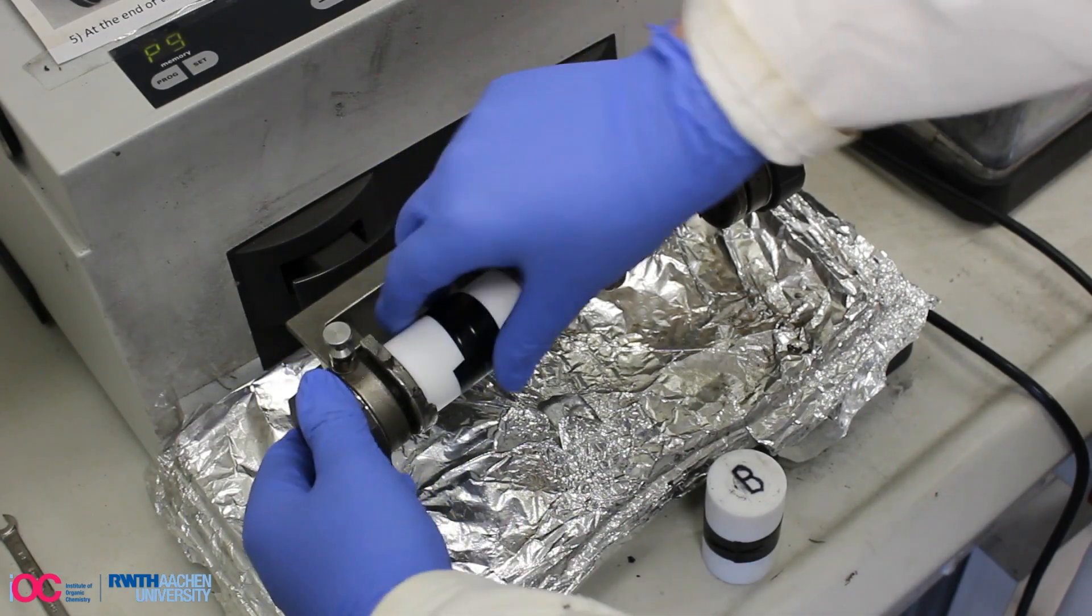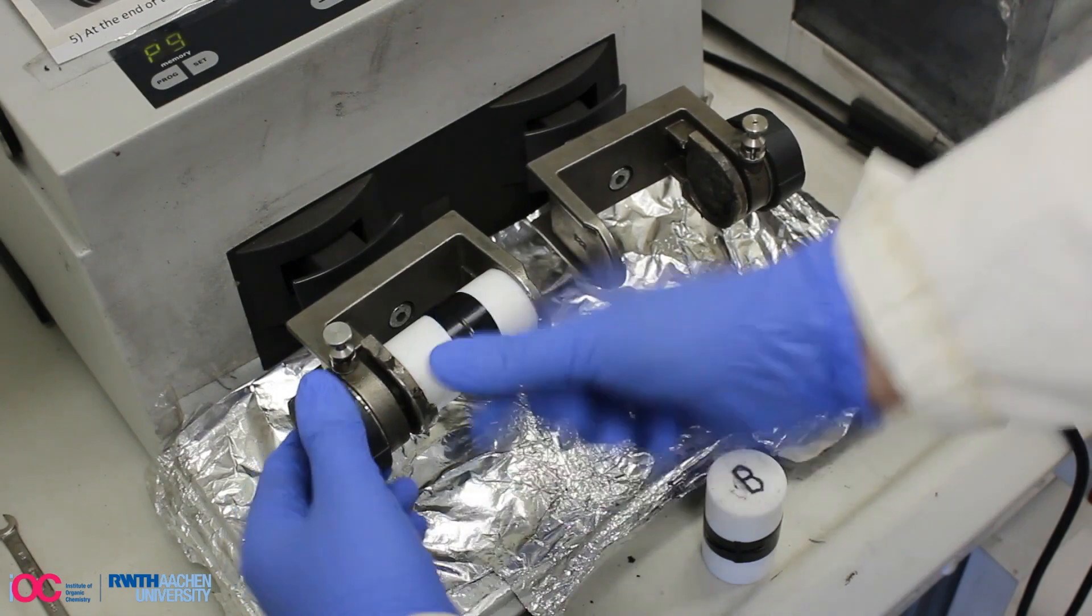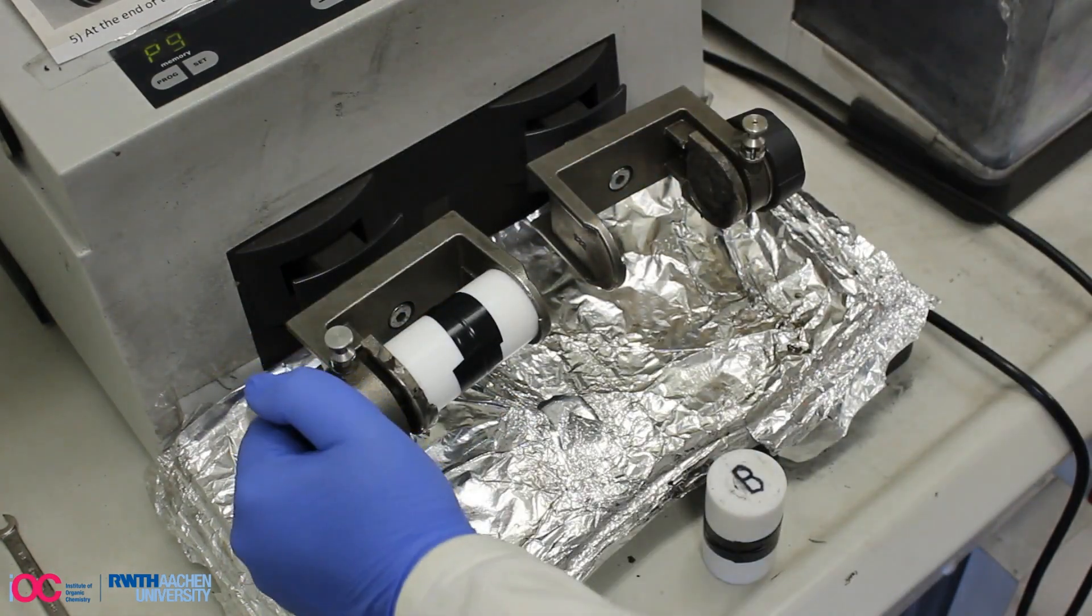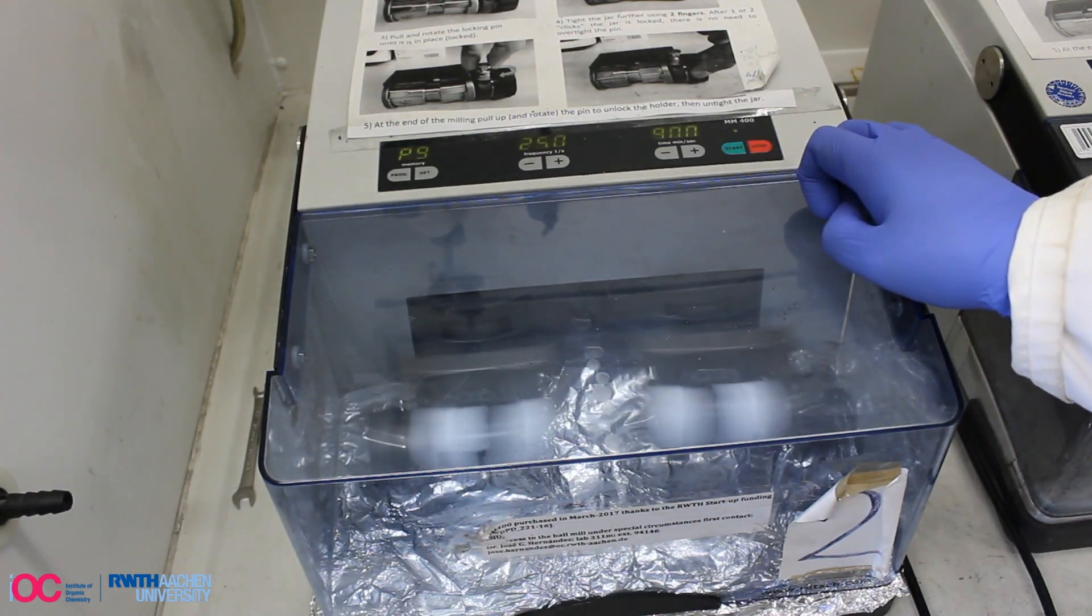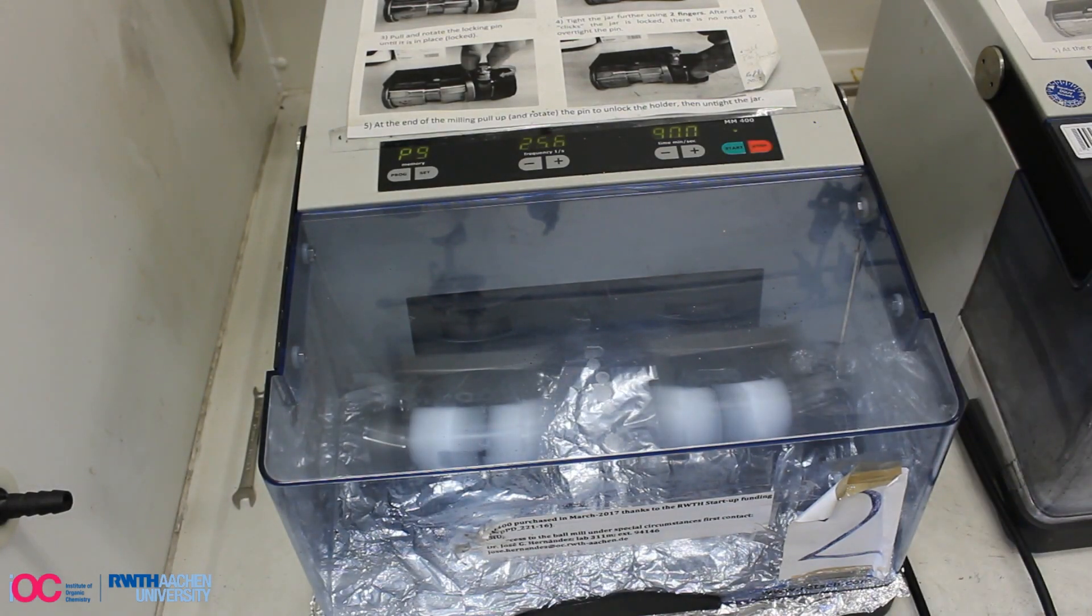Check whether the milling jar is held securely. We are using a Retsch mixer mill MM400 milling device. The reaction is conducted for a milling time of 90 minutes at a frequency of 25 Hz.